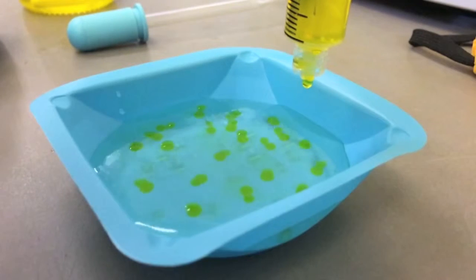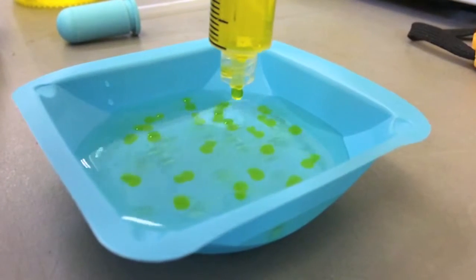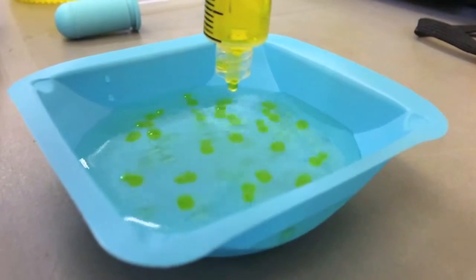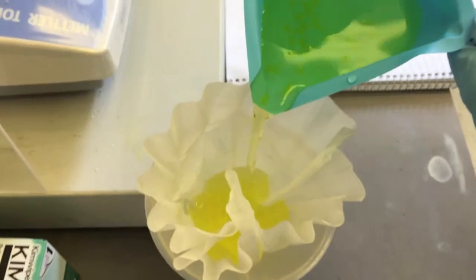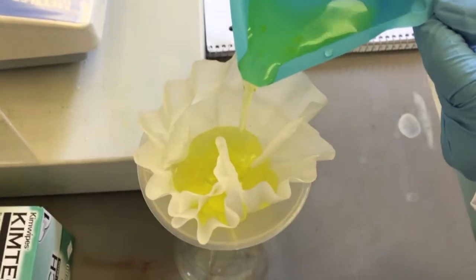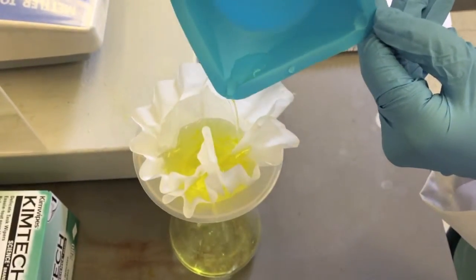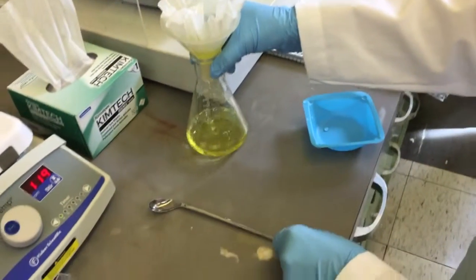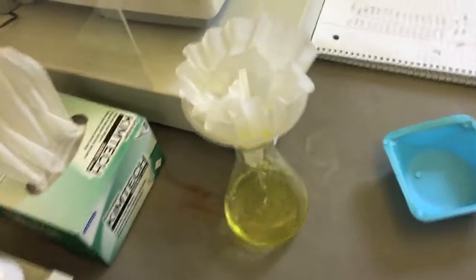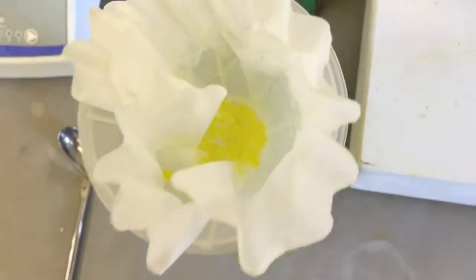Cross-linking time is also an important factor. We waited 5 minutes after dropping the beads into the calcium chloride solution to allow them to cross-link. More time would result in more cross-linking and a stronger hydrogel matrix. In one instance, we used a different type of filter. The calcium chloride solution took much longer to filter through, and the cross-linking time was essentially increased by about 2 minutes. Significant variations in the cross-linking time may lead to experimental error.